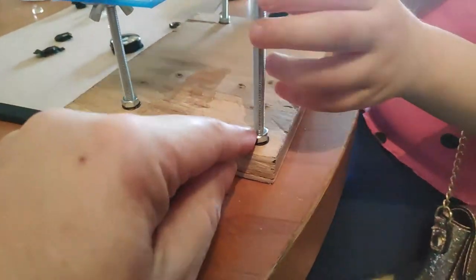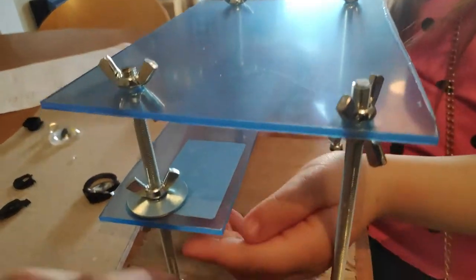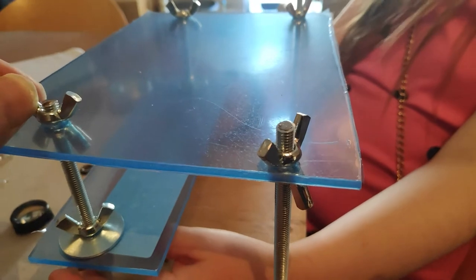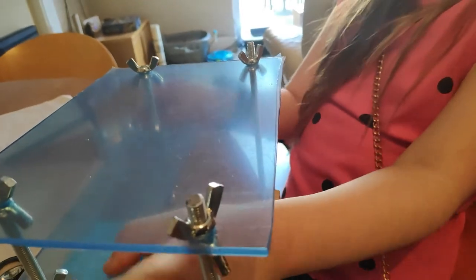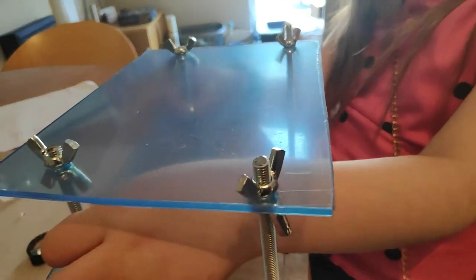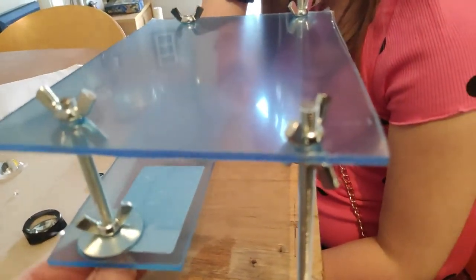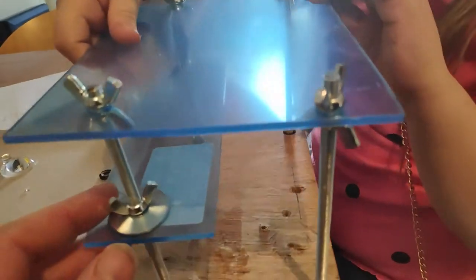Then we put another screw and washers on so it didn't hurt the wood, and you tightened them up. Then we put some washers and some wingnuts. We put some on, then some very big washers, then two more wingnuts. And why didn't we put wingnuts everywhere? Because we might want to change the height of everything — so we can change the height to get the focus when we use the microscope, because different lenses work differently.